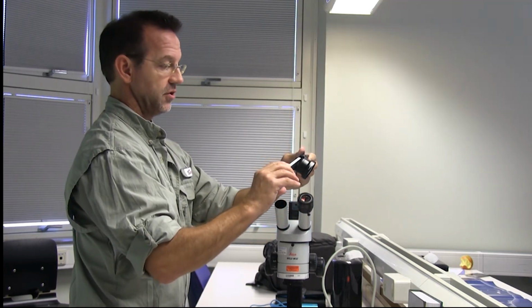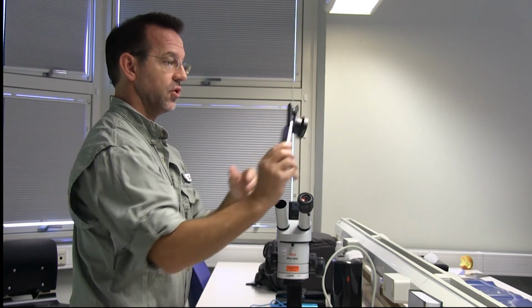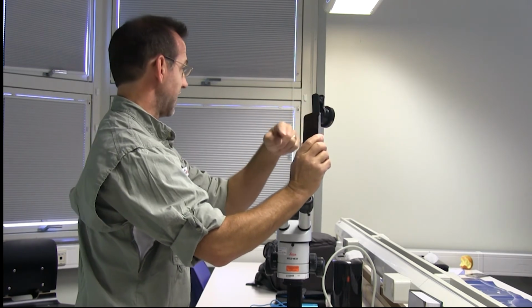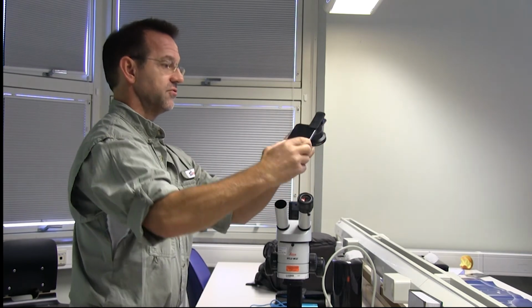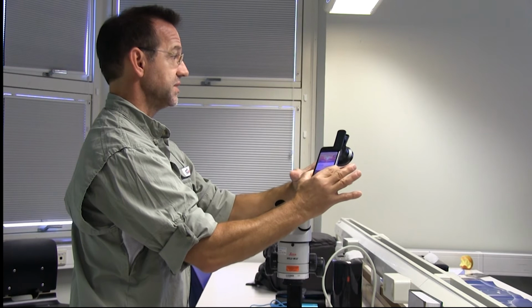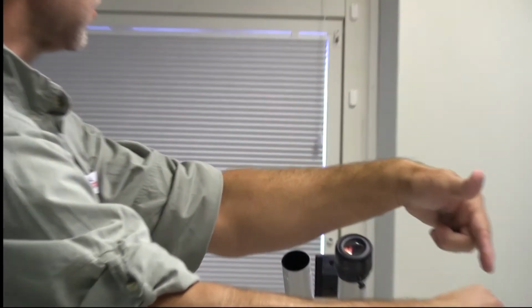When you put this on and line it up with the phone camera, and sometimes the phone camera's in the middle or on the side depending on which model you have, the wide angle lens will help you get a picture of the whole disk, which is really nice. So you can get very, very close to the whole disk, get the whole picture there.